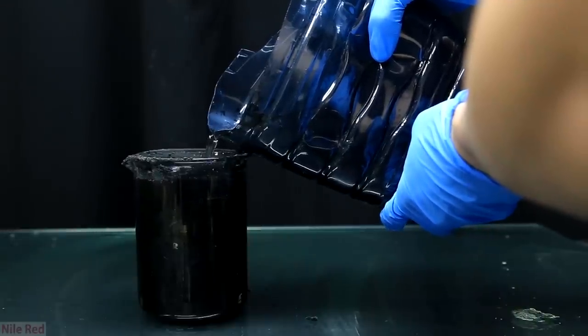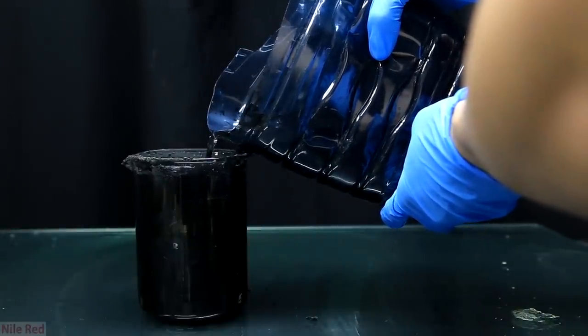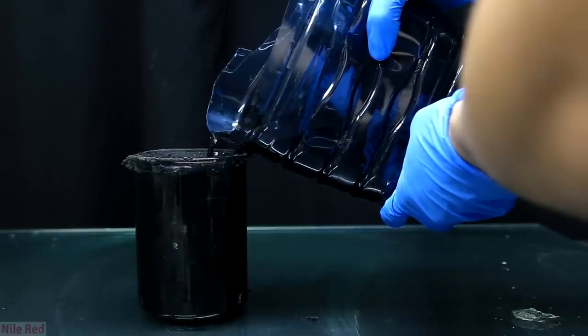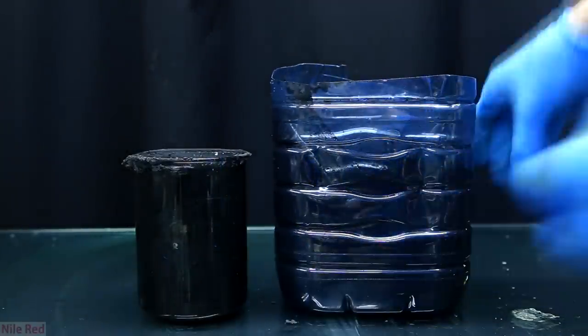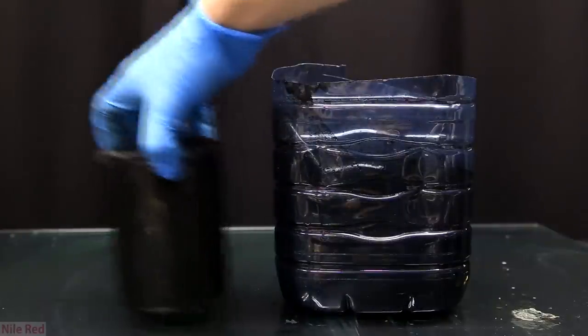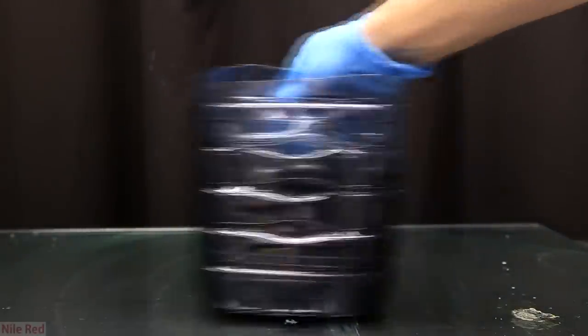If you want to do another washing step you can add more water, stir it up and let it separate again. For me personally I only used one because I didn't care too much about the purity. So as I said before we don't need this solution anymore and we can discard it.